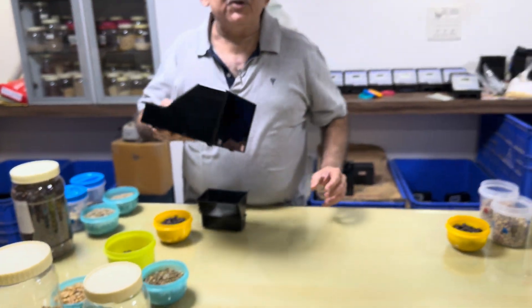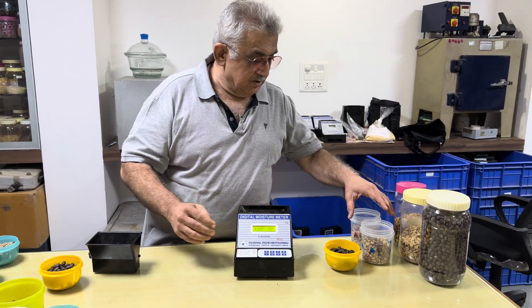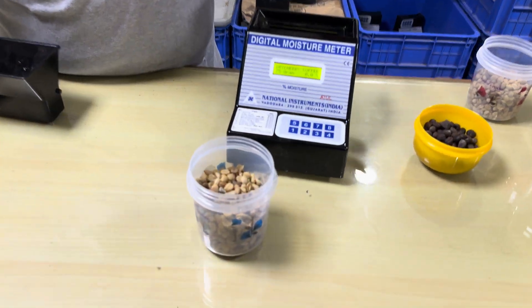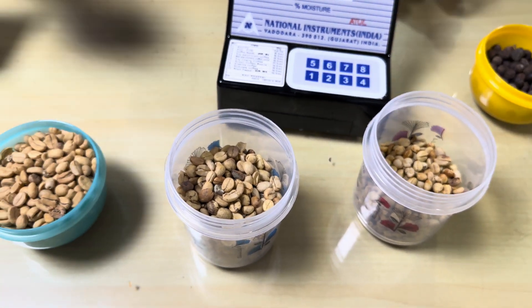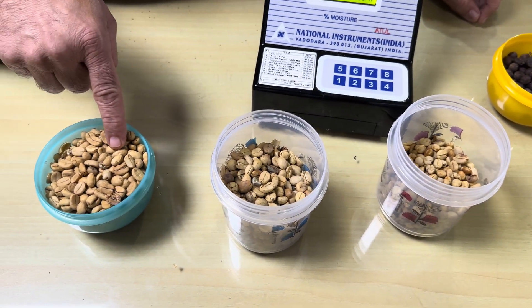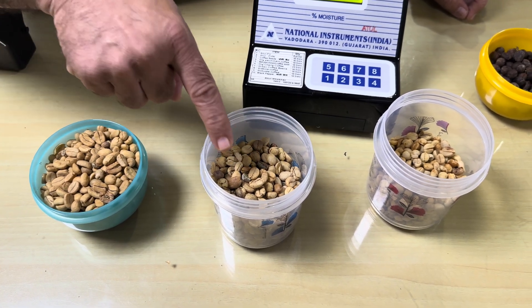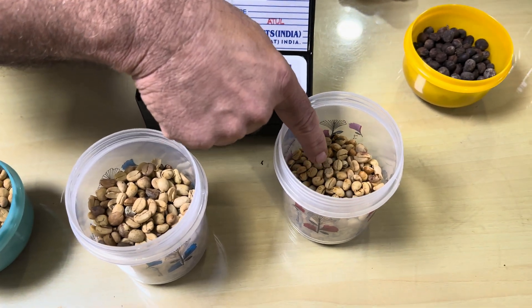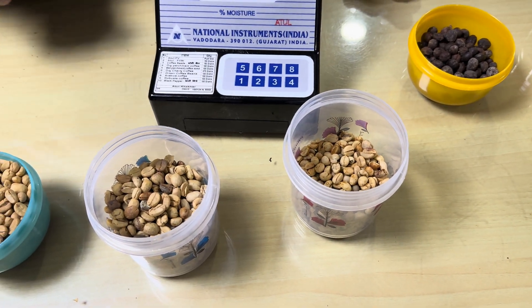Now we will measure the moisture contained in parchment. This is the parchment coffee samples — you can see these 3 here. This is an elongated coffee so it is called Arabica; this one is also Arabica.